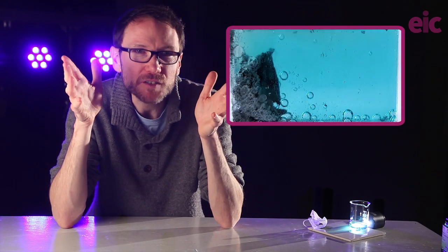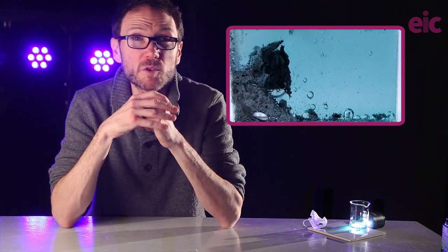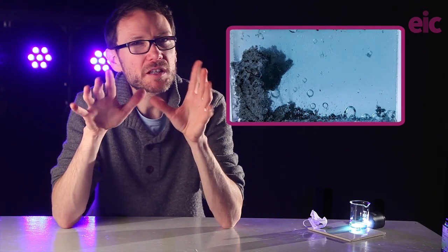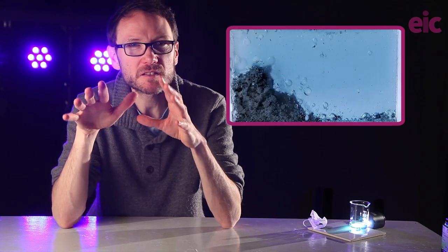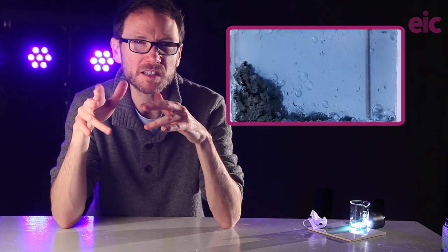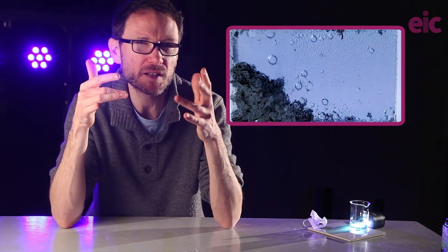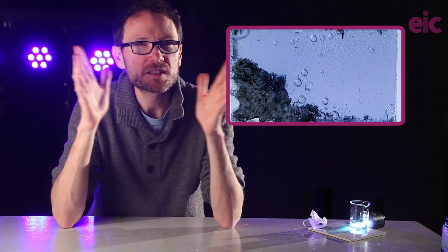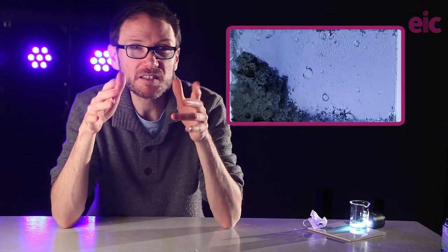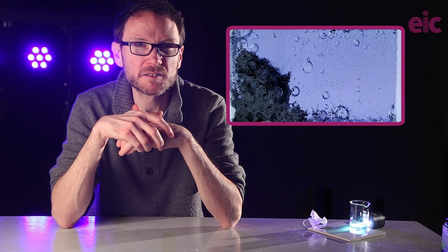And at the scale of an indicator strip box, you can see this from some distance. For smaller classes, this may already be a good solution. Although I would recommend not using a visualizer, I often noted that the raw camera footage seemed to make vanadium 3 look a lot bluer than it actually looked in real life. So if you're projecting this onto a screen, it probably isn't going to look great. So it could work for a practical though, and this produces much nicer colors than just dumping powder into a tube of the solution and getting a cloudy mess.